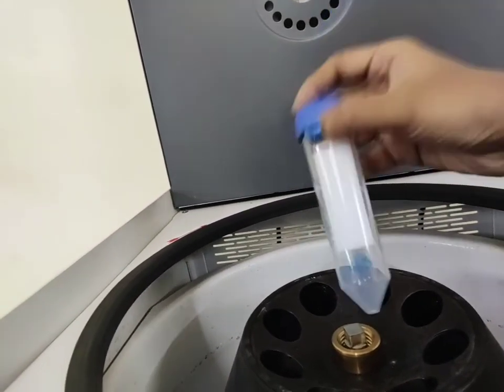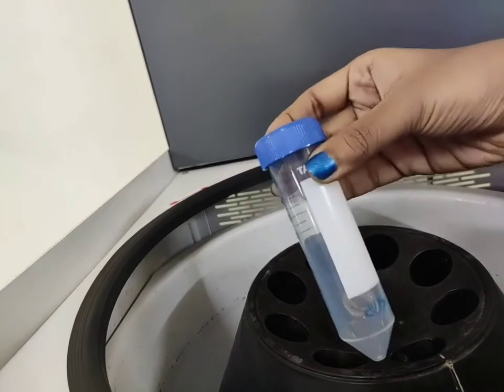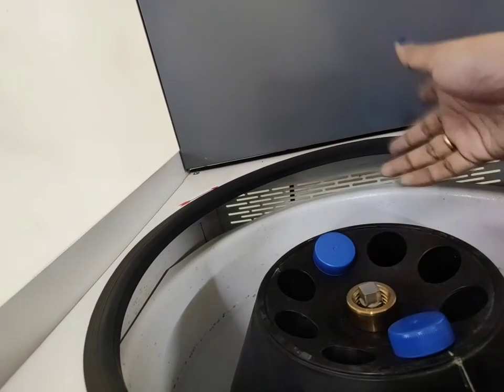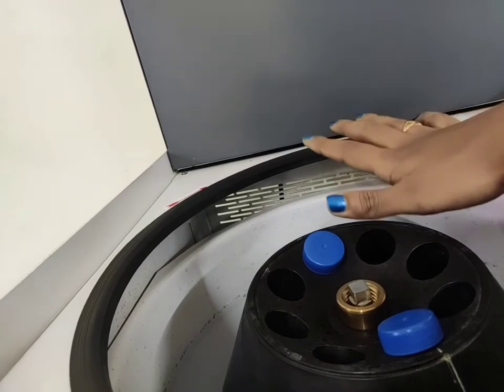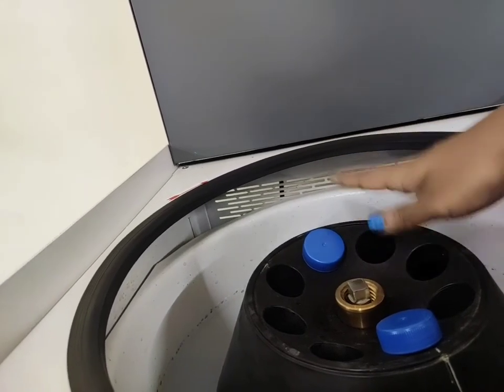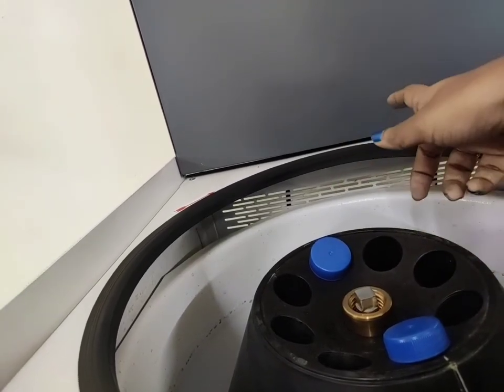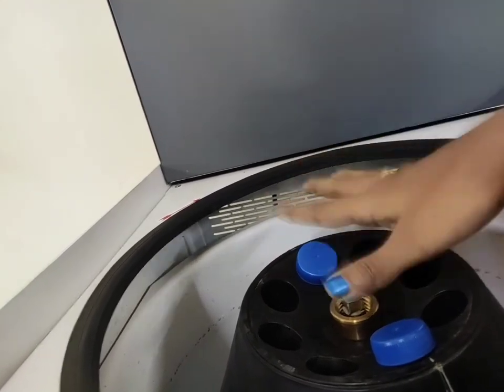As mentioned, whenever you keep sample you must ensure the instrument is balanced — keep tubes in exactly opposite positions. Suppose one tube is 50 grams, the other tube also of exactly 50 grams must go in the opposite position. This applies for 2 tubes, 4 tubes, or 6 tubes — always keep them balanced in opposite positions. In case you have only 3 samples, keep 2 samples opposite to each other, place the third sample in one slot, and in the opposite slot place a blank — water or any other solvent — making sure all tubes are of the same weight.